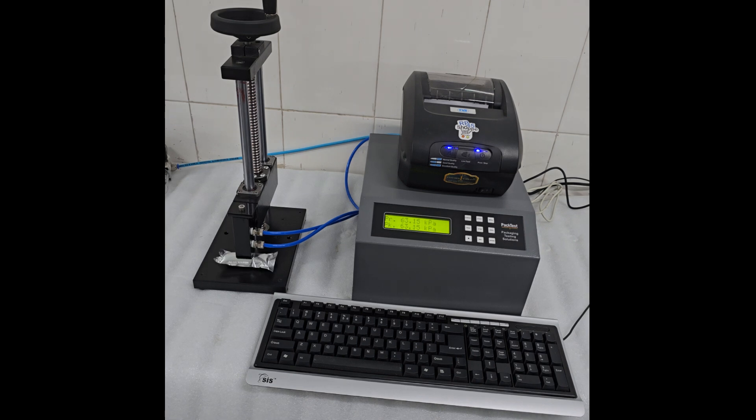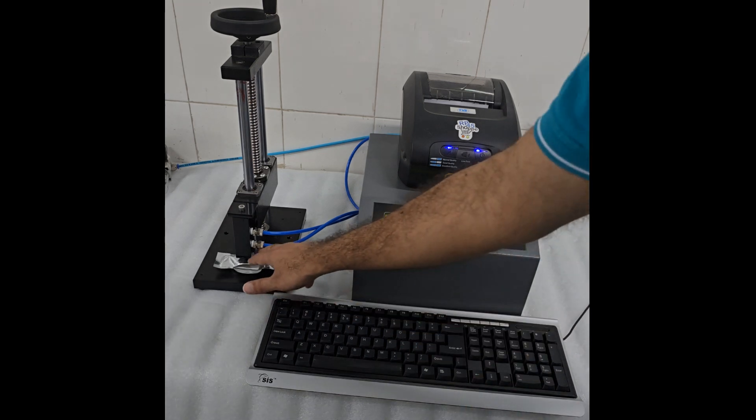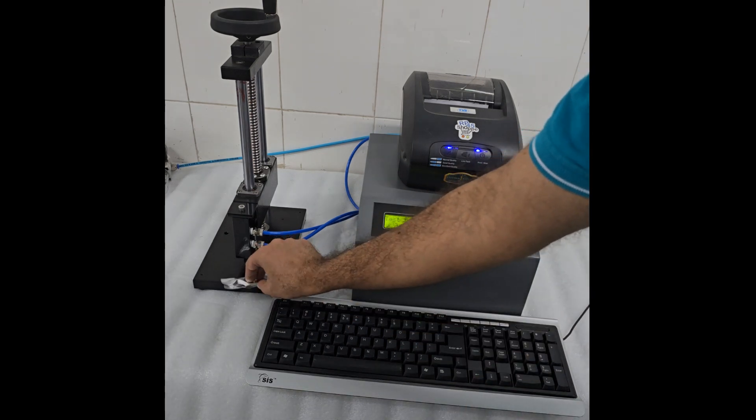Test the remaining samples in the same way. You can test a maximum of 20 samples, after which the memory will be full.